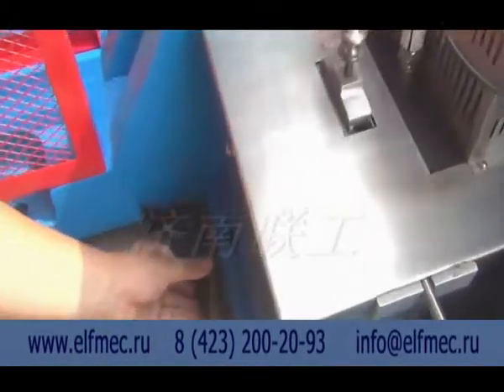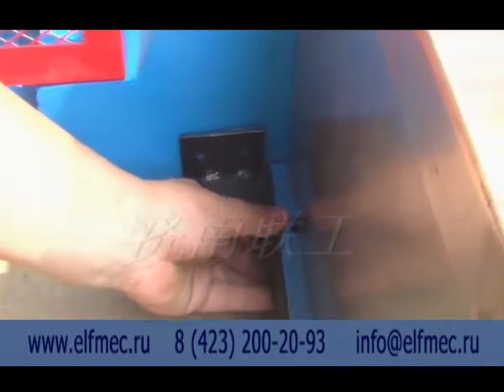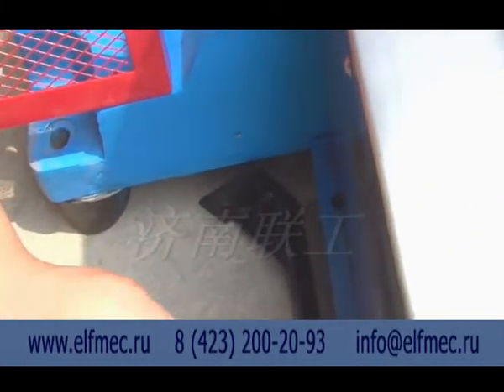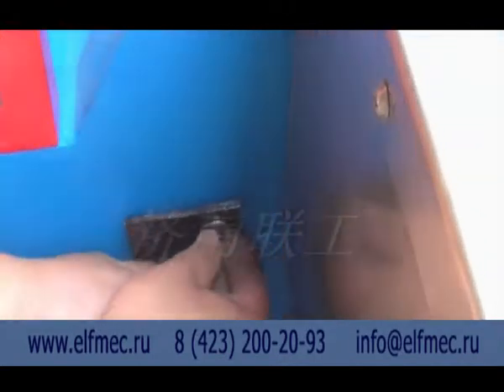We must make sure that the host works normally before connecting the host with the feeding equipment. Connect two pieces of connecting plate with the host and automatic feeding device separately, and tighten them with connection screws.